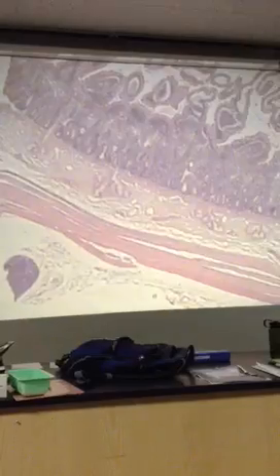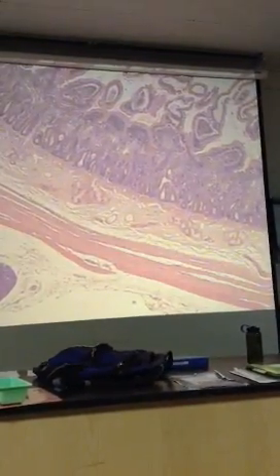Three regions. That first one is the duodenum or the duodenum. Pronouncing either way is fine. And this is the smallest region. It's only about 10 inches long, that first duodenum. Small intestine is where you have nutrient absorption.